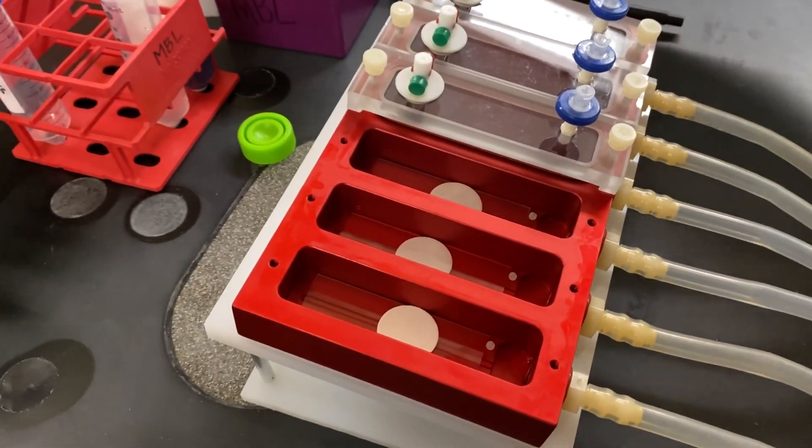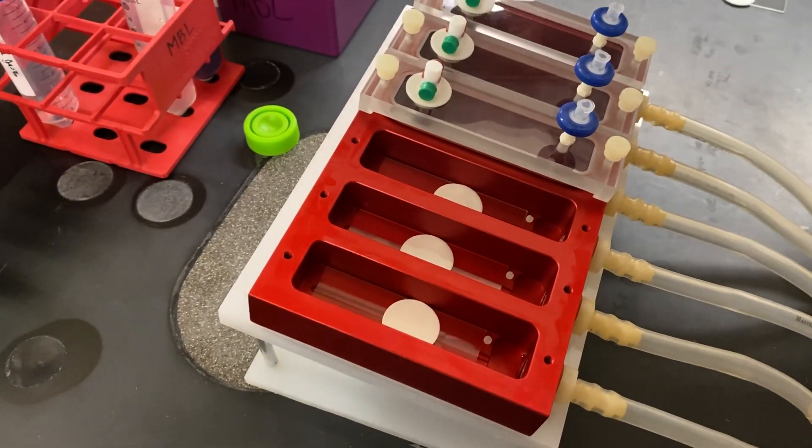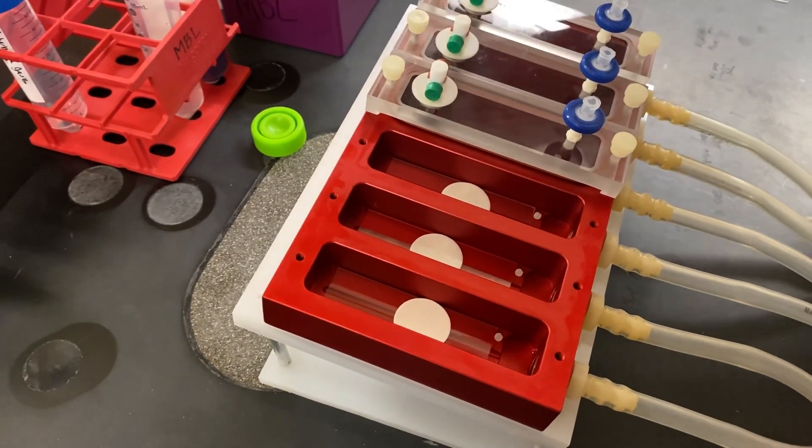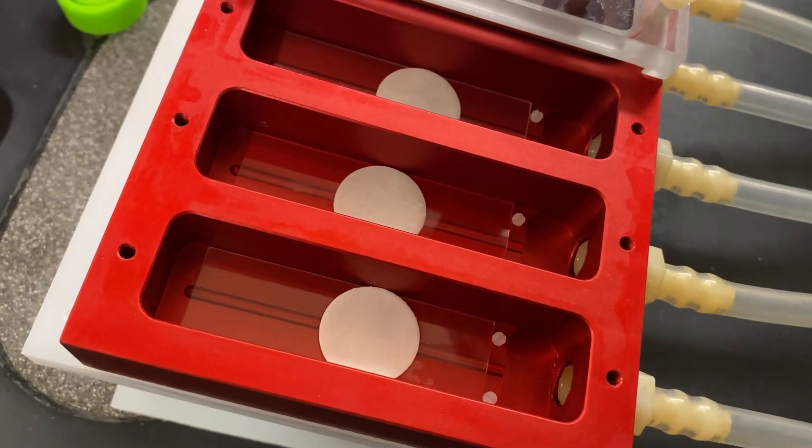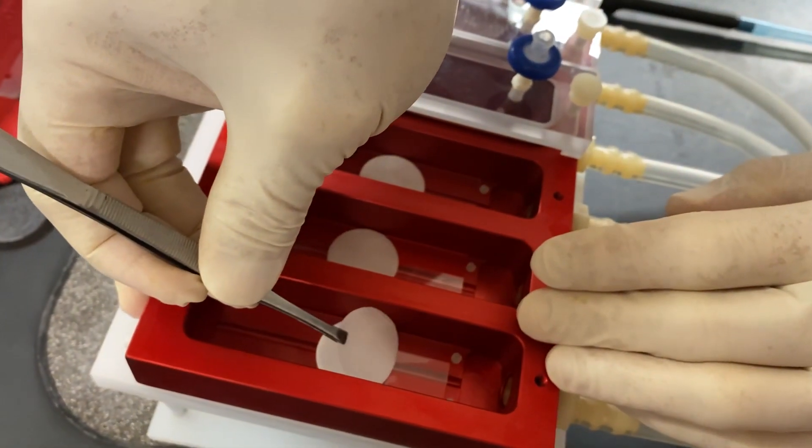When we're ready to run the reactor, we open it, hydrate the pad, and place a sterile 0.2 micron membrane on the pad.